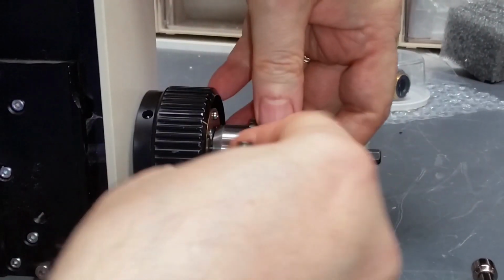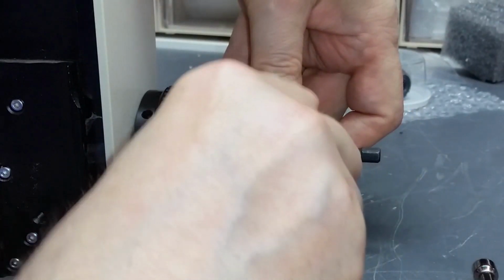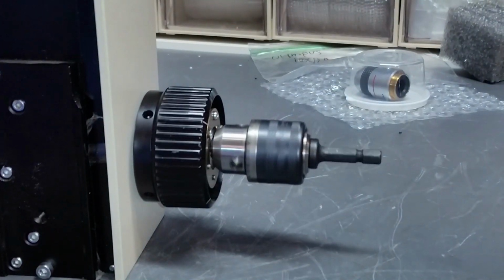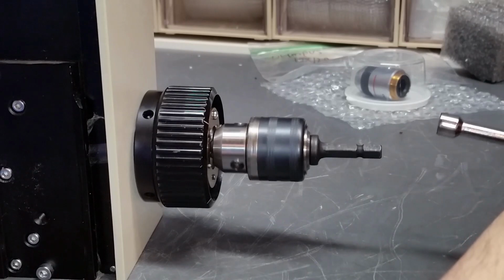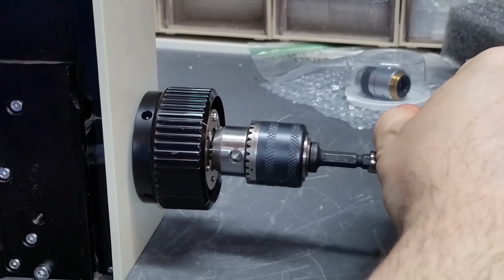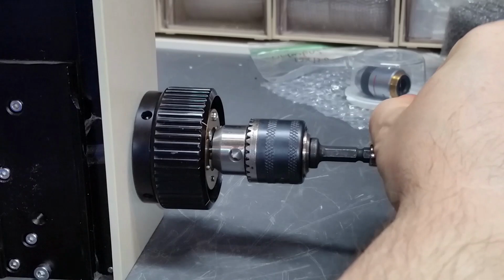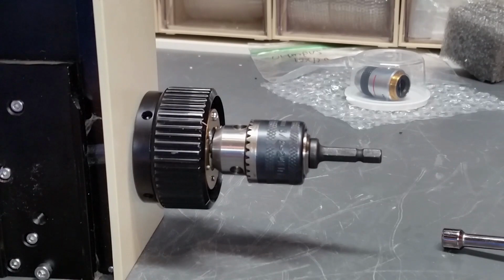It's actually a little bit loose still on the shaft. I think I'm going to tighten that down, make sure I'm not fooling myself here. Okay. So now it's snug on the shaft. Rotate it to its high position. Bend it down. And of course, you have to bend it beyond the point where it would be straight. You have to go from the elastic deformation point of the material to the plastic deformation. Right now that looks pretty decent. See that? I might have actually got something that's usable.